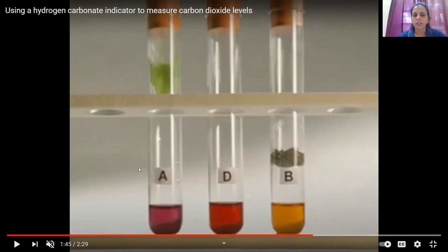Now you can make out here, this test tube D is control. So the color of hydrogen carbonate indicator here is the same as the original color. In test tube A, because this leaf was placed, the leaf has performed photosynthesis and hence carbon dioxide concentration is decreased inside this test tube. So the color of hydrogen carbonate indicator has changed to purple.